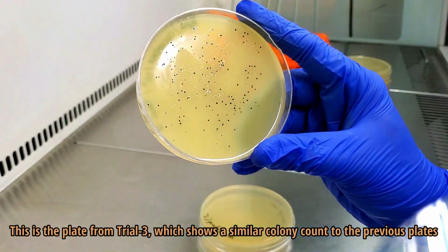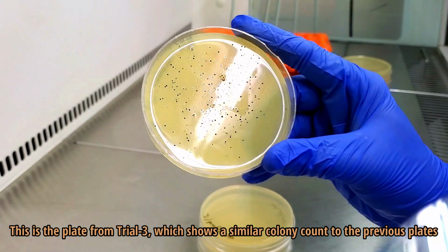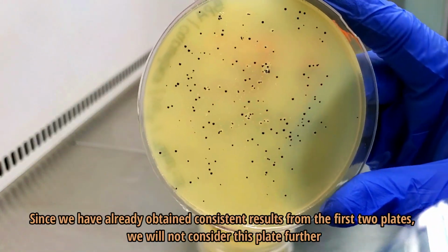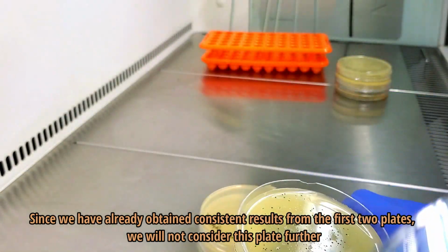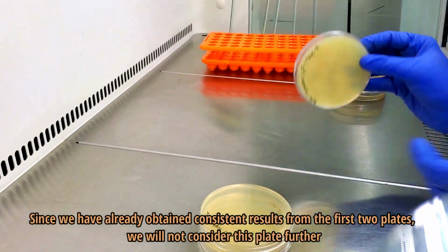This is the plate from trial 3, which shows a similar colony count to the previous plates. Since we have already obtained consistent results from the first 2 plates, we will not consider this plate further.